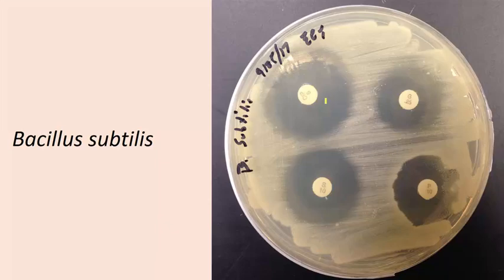This is showing you Bacillus subtilis, right? So the Bacillus subtilis was spread all over this agar to try and grow, and then those same 4 antibiotic discs were added to the petri dish as the bacteria grew in the incubator. And what you can see is that Bacillus subtilis is susceptible to all 4 of these different kinds of antibiotics. So the zone of inhibition is relatively large for each of these 4 antibiotics that are shown.